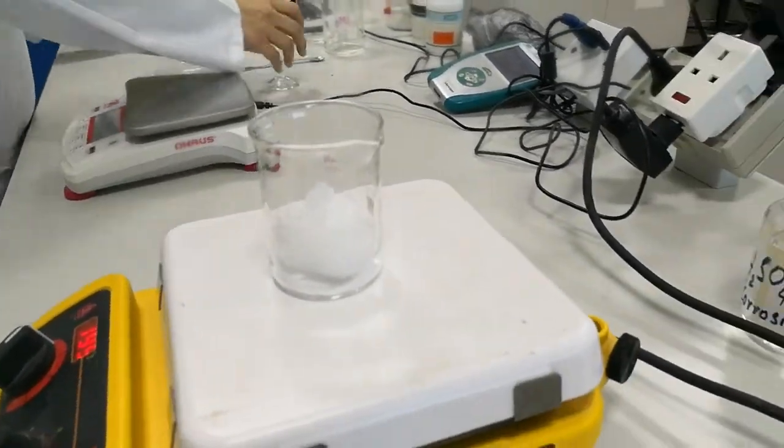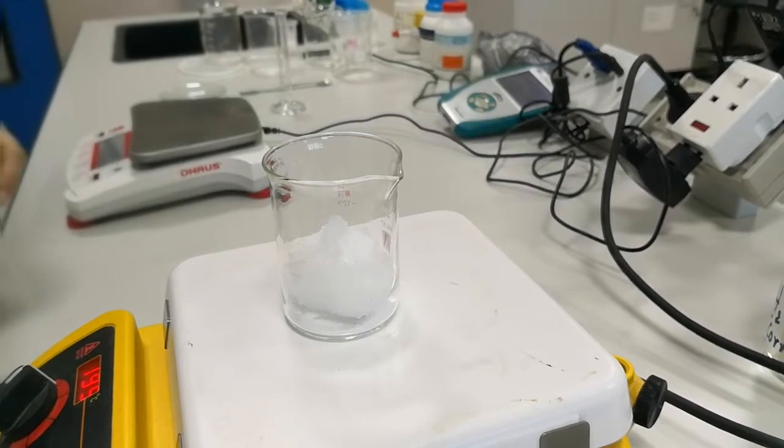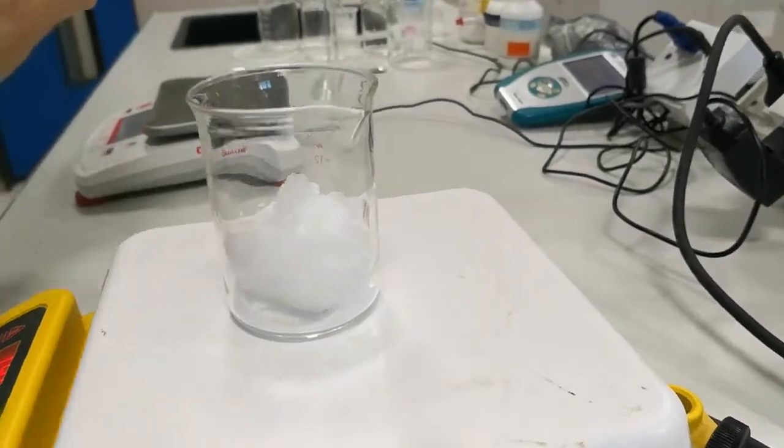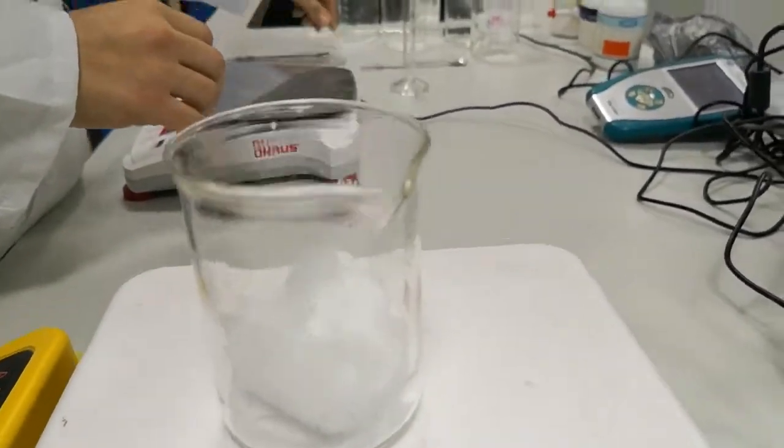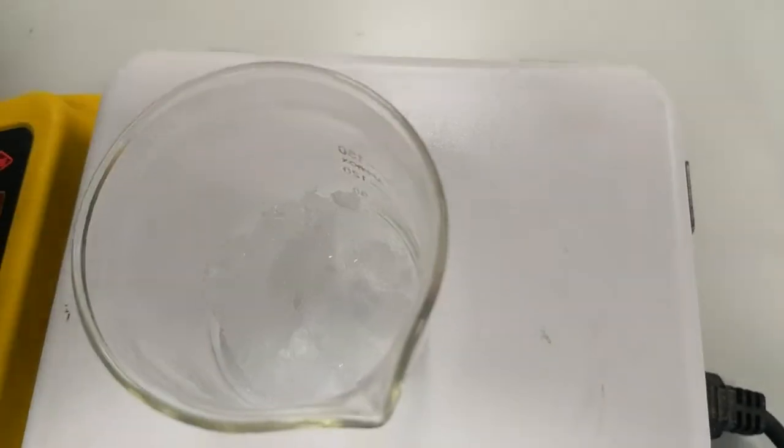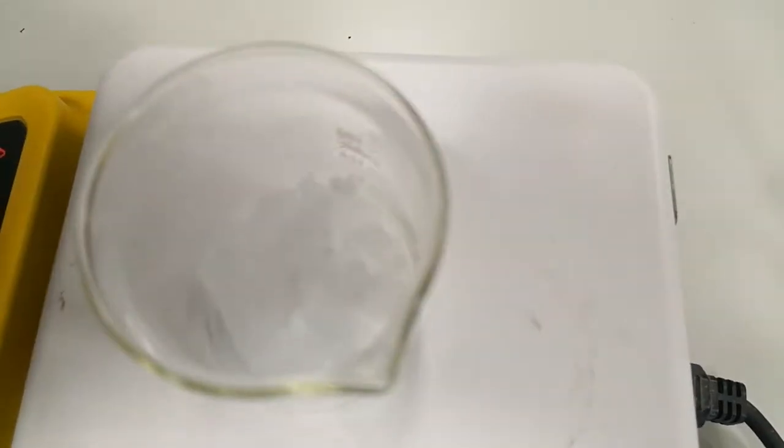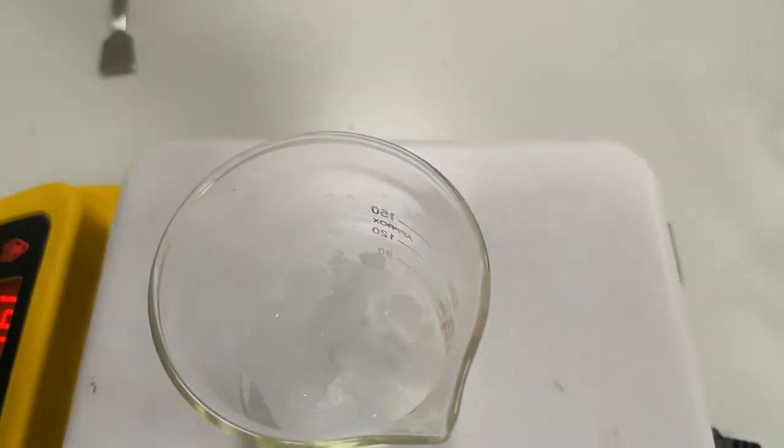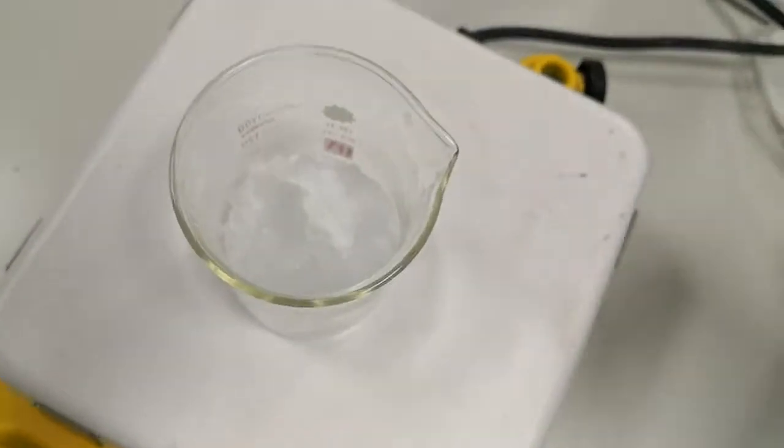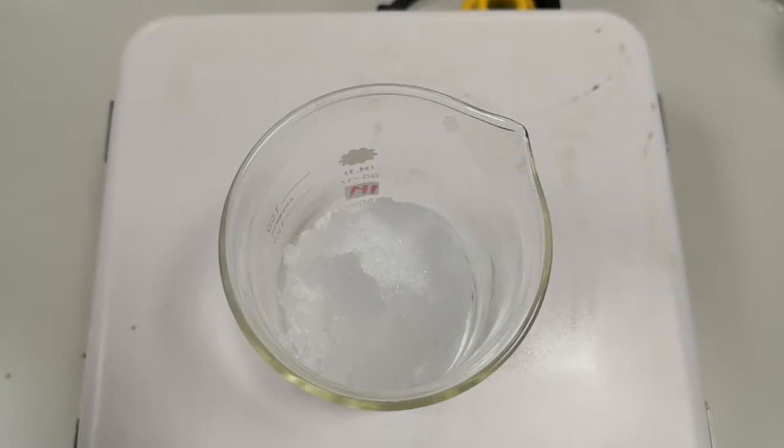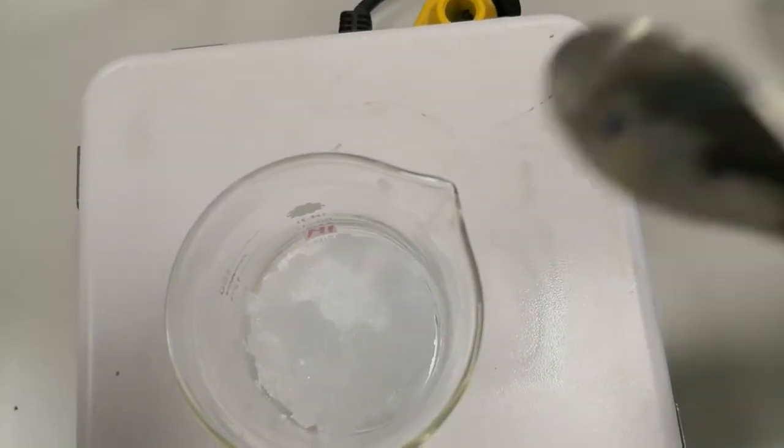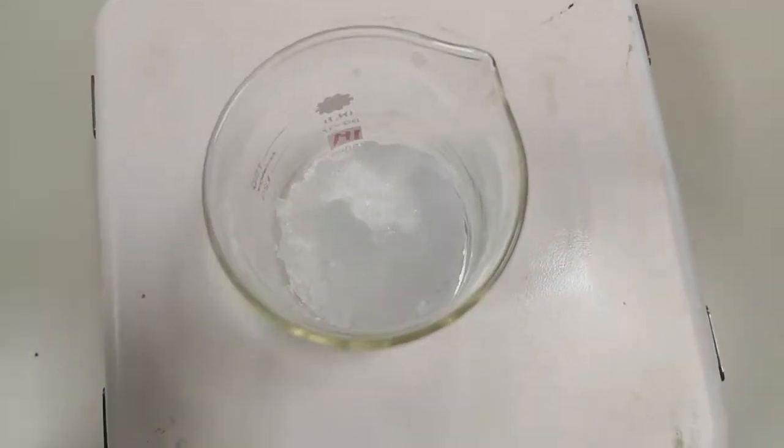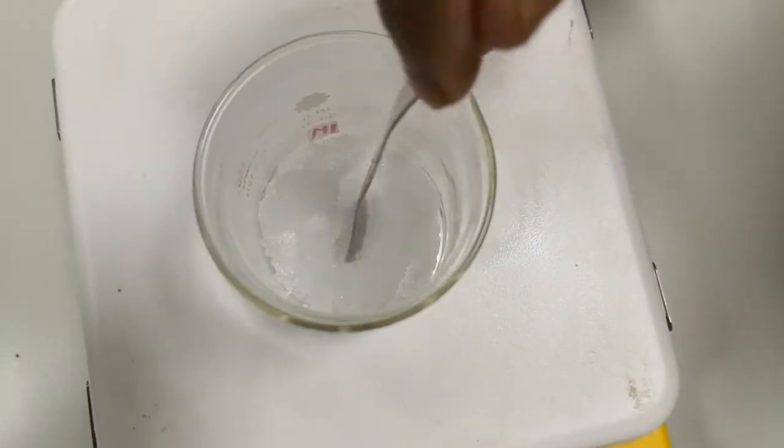And let it dissolve in the 5 milliliters of water. It's going to take some time to dissolve but definitely the temperature will make it dissolve.